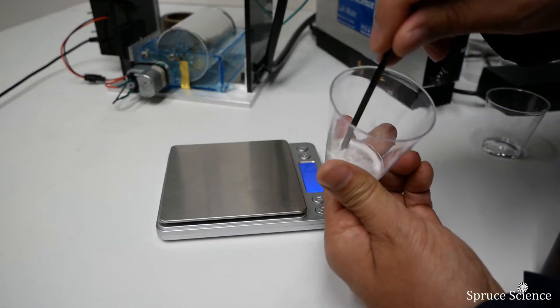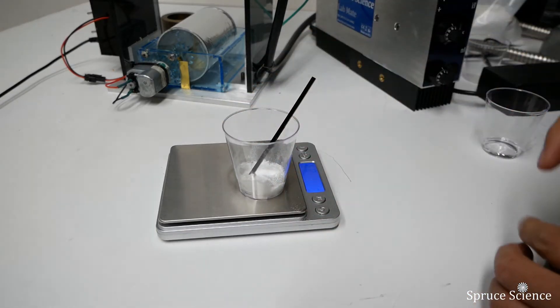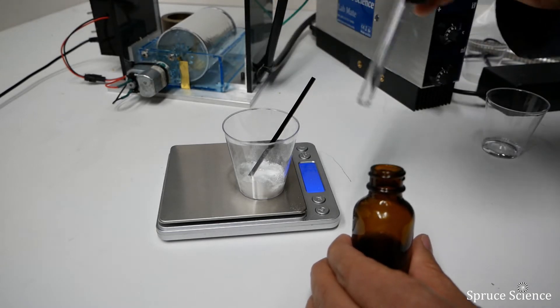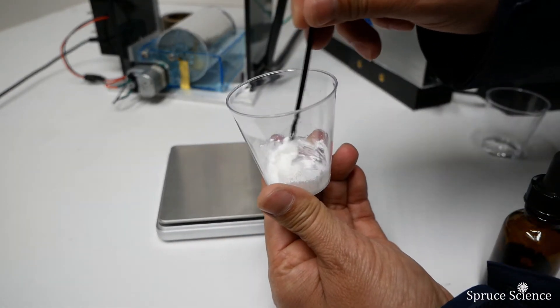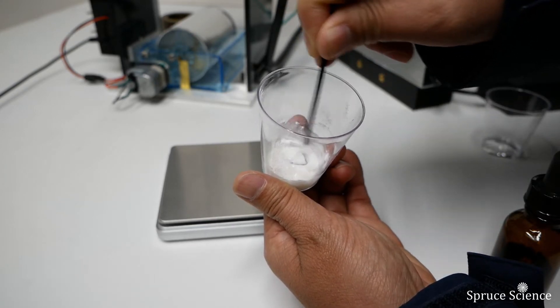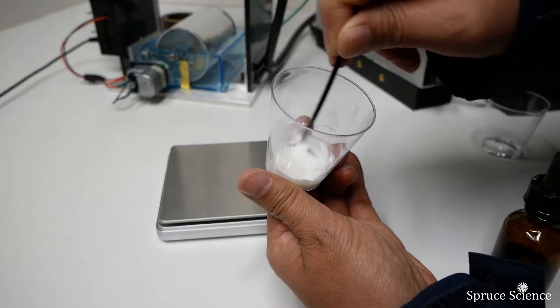We first added 0.6 grams of alcohol, but the solution was very lumpy. So we added more alcohol, and the total alcohol weight was equal to the weight of the powders. We mix everything together to form a viscous solution. This is one of the parameters that you would optimize to get nanofibers with certain characteristics that would fit your application or interest.